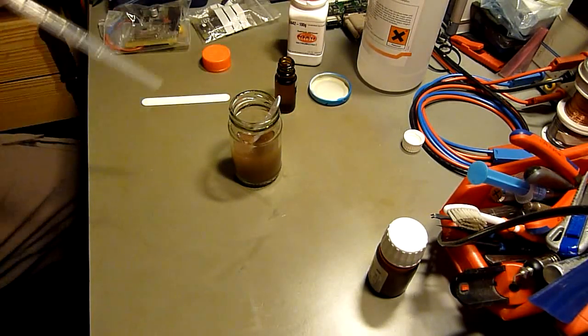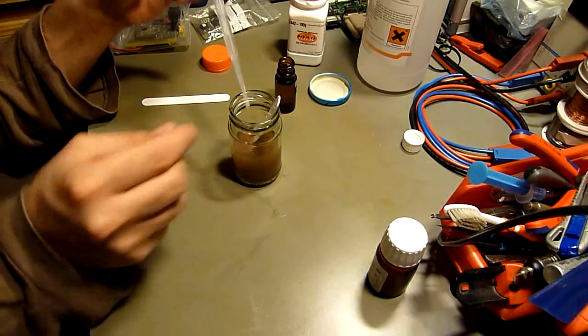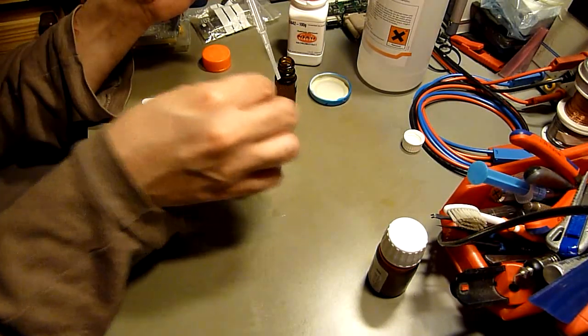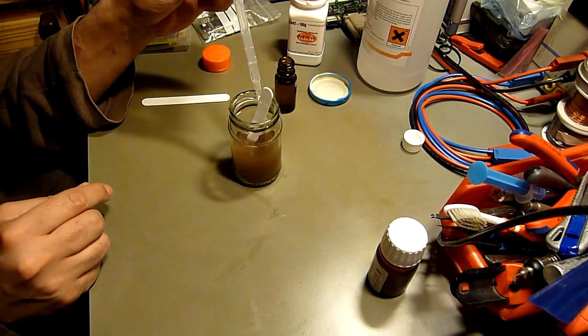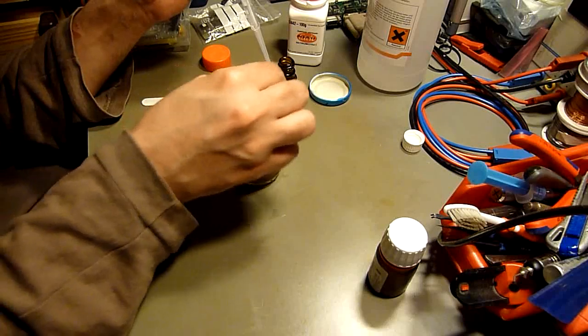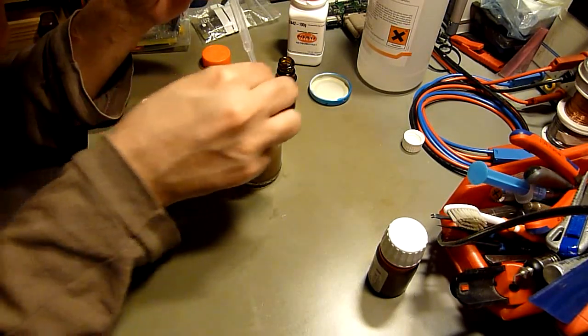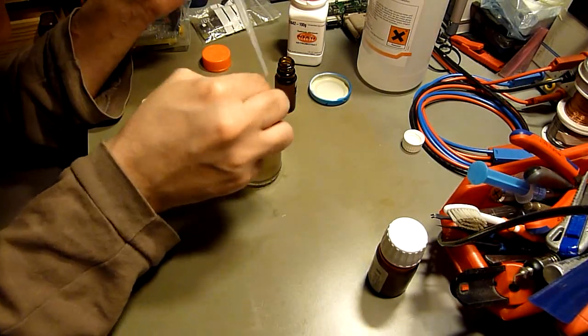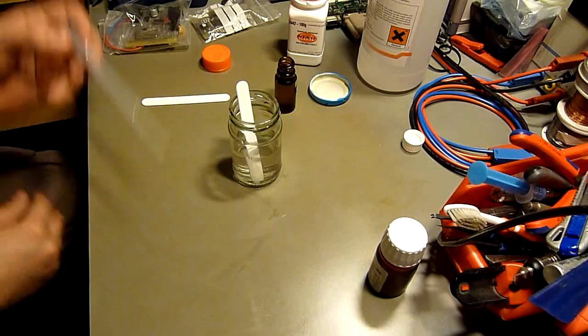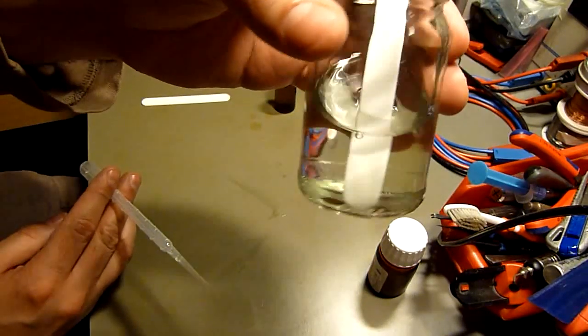All right, this time I'll add a little more. Much more, much more. Now it's getting clearer and I guess now it will turn—yep, it's now turning. And we add just so much that it turns again and we get a clear solution again.